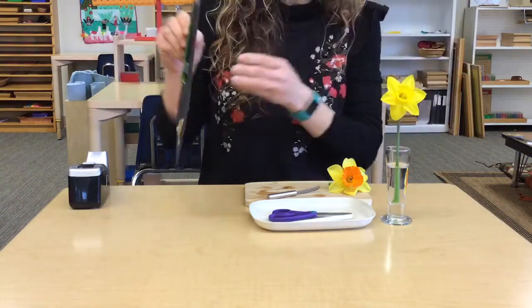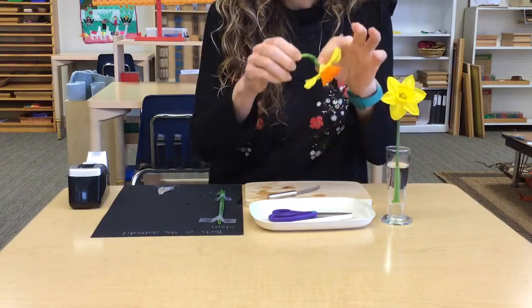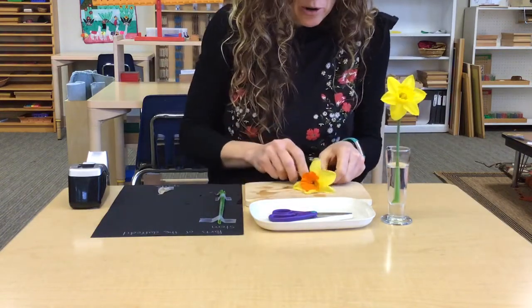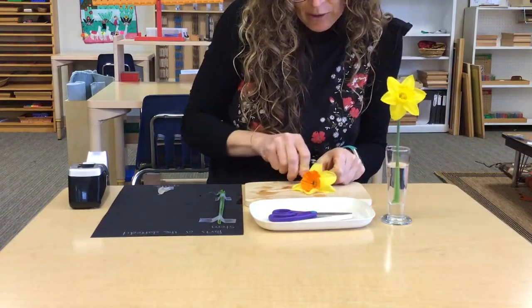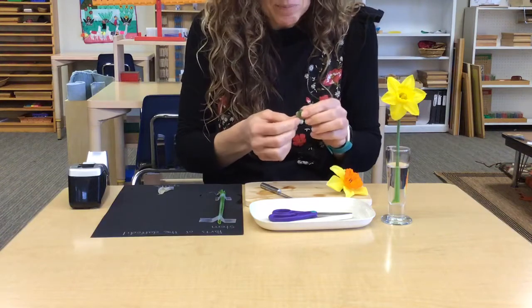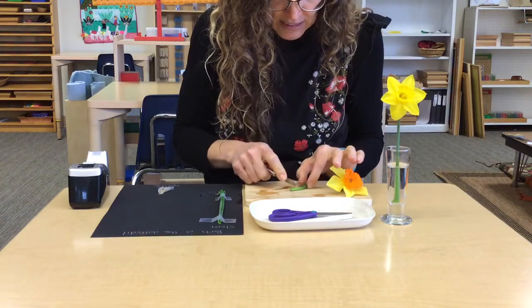If you're watching this video and doing it at home, you can pause in between each step if you need a little bit more time. Now, you'll notice a swollen section of the stem right here. That is called the ovary. It's interesting because a flower has an ovary, and so does a female human or many other female animals. And the ovary is where the eggs are stored. In a flower, those eggs are seeds.